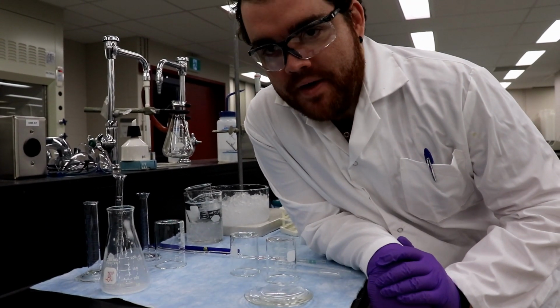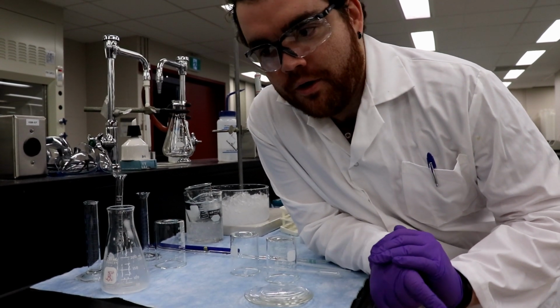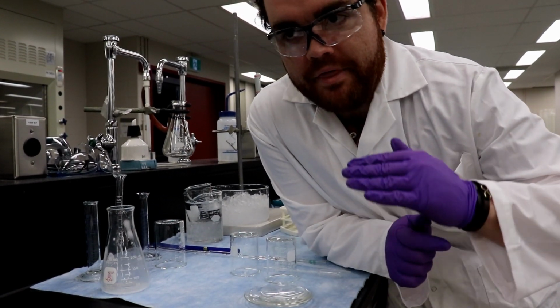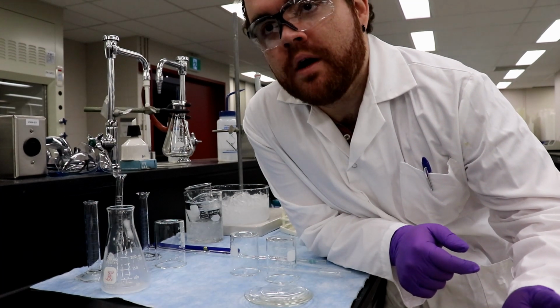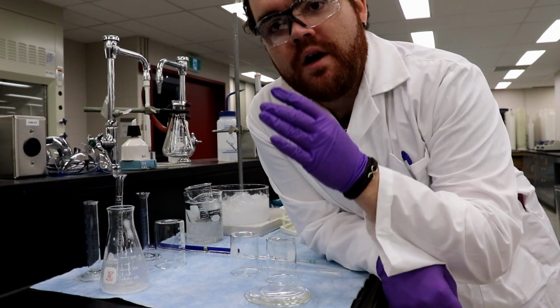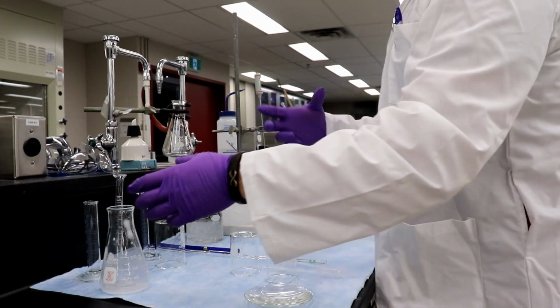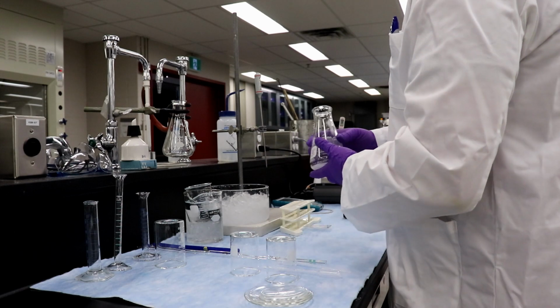Okay, and we're back. So water bath's at 60 degrees Celsius and heating up. Little trick for everyone down the road. If you're heating up a water bath and it starts to go above the temperature you want, so we want to keep this between 60 and 70 degrees, if it starts to get 68 or so, we can just take it off the heater, and then it'll cool down. You can put it back on. You can basically just tease the heat like that for a while.